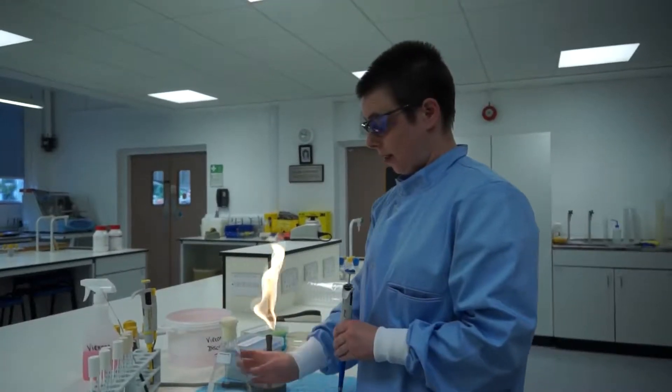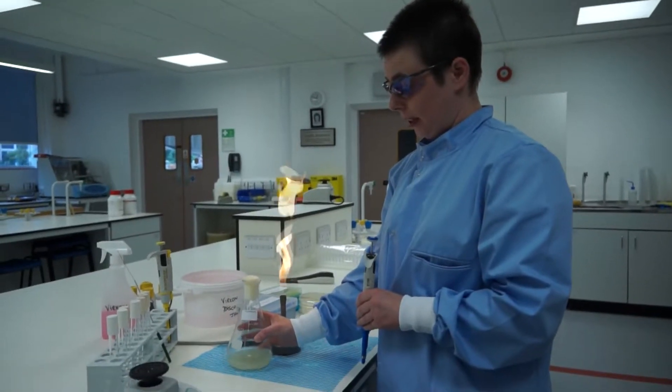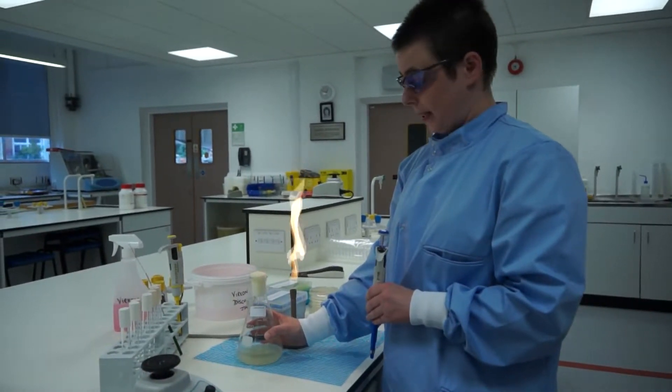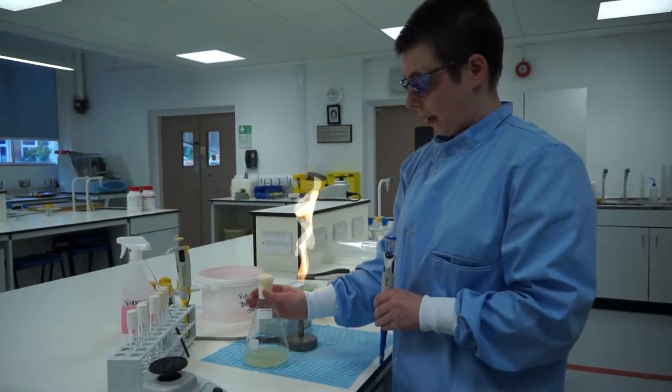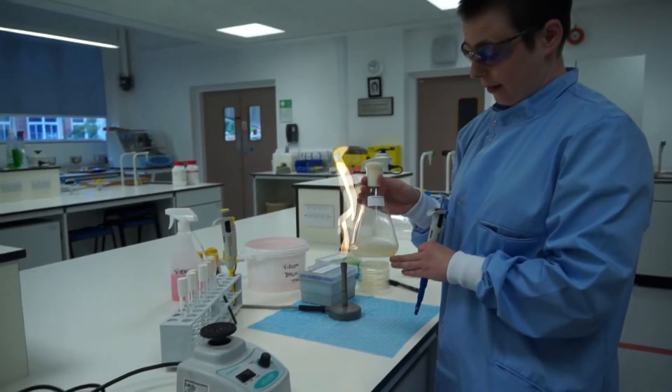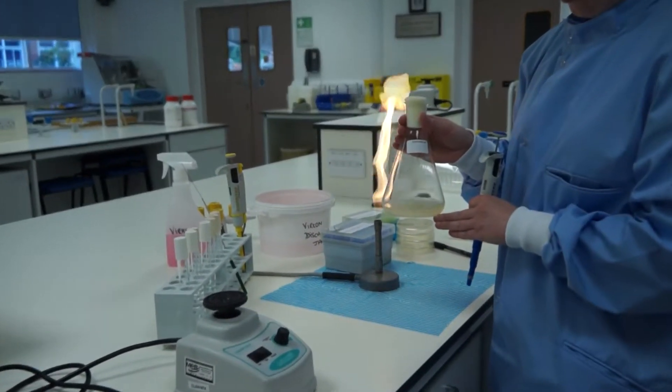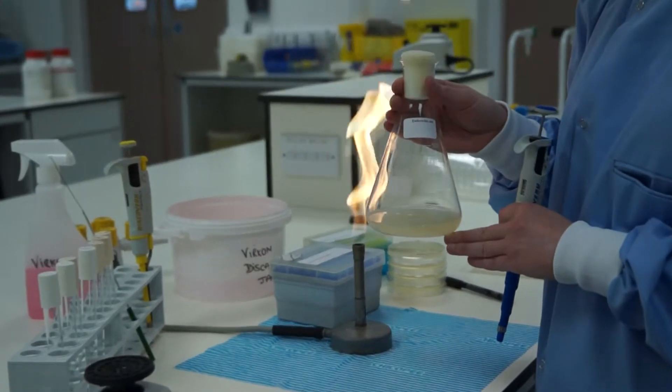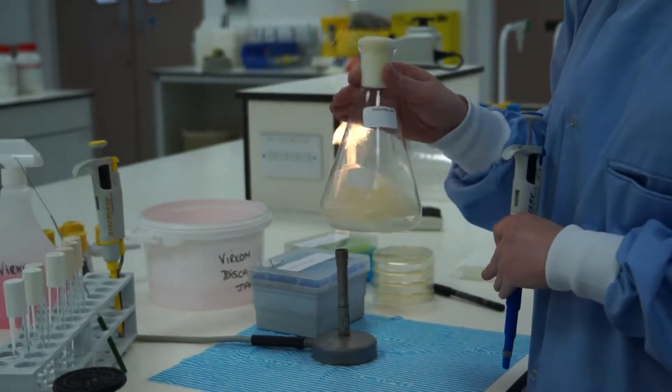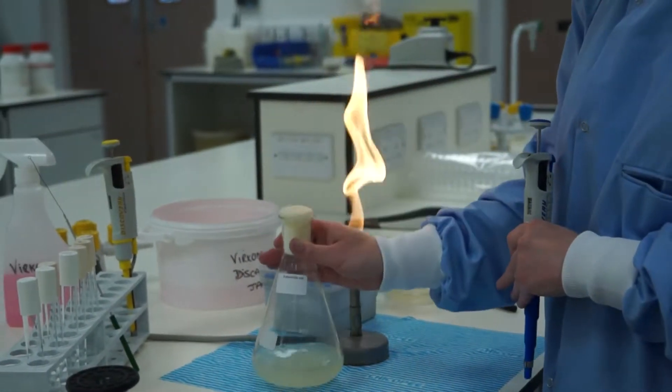We are going to now do serial dilution and spread plate. I'm going to be plating this overnight culture of Escherichia coli. The E. coli needs to be well mixed before I start.